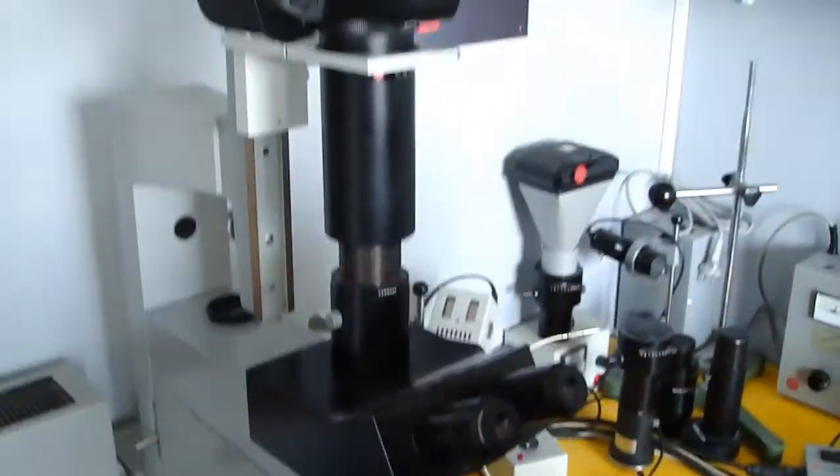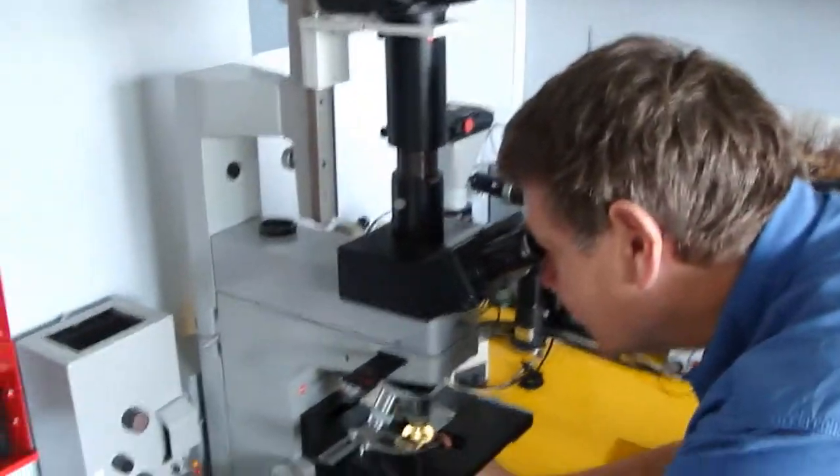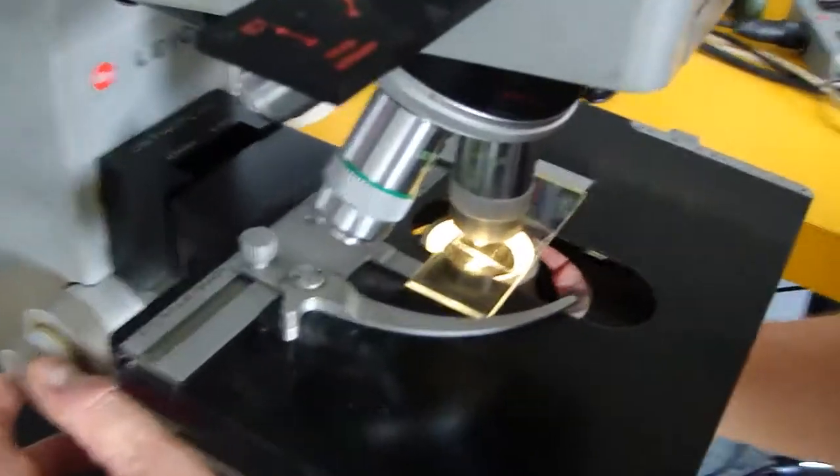We're testing the 5D Canon camera on the microscope. We have some trials and it looks very promising. It's very good and it's quite simple.